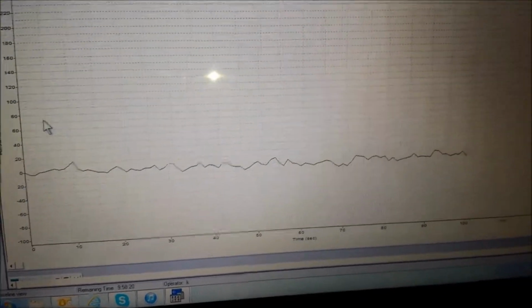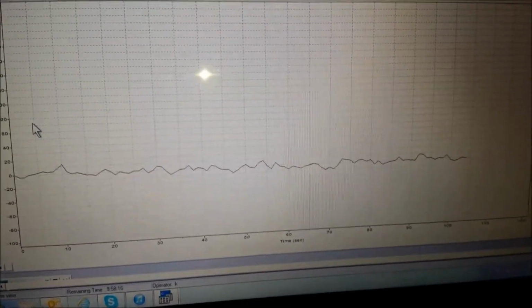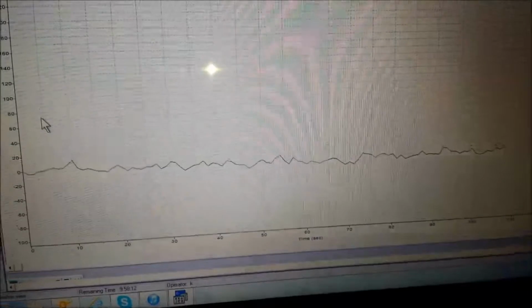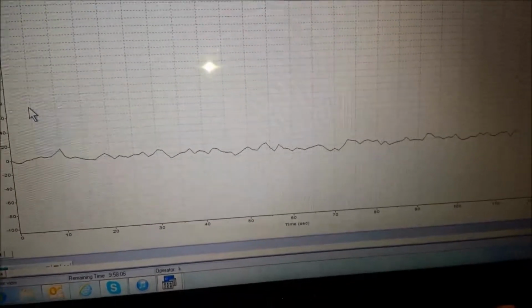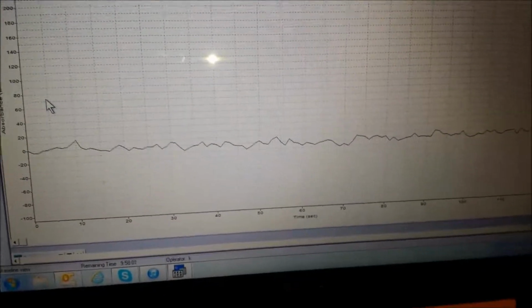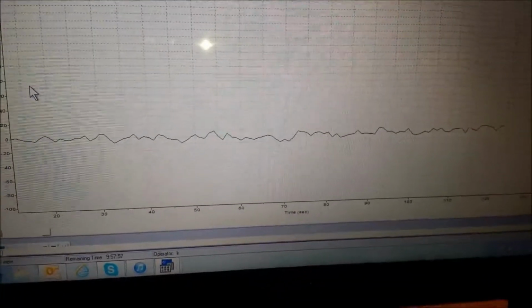Now when you add your reagents, you know that mechanically your system is working fine, your detector's fine, your debubbler's fine, your photodiode is fine, the fluids that are flowing through the flow cell are fine, you probably don't have a bubble. So when you add your reagents, if you do have any issues, you know they're related just to your bubbles. They're related just to your new reagents.